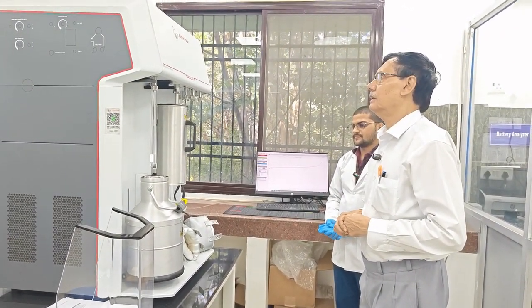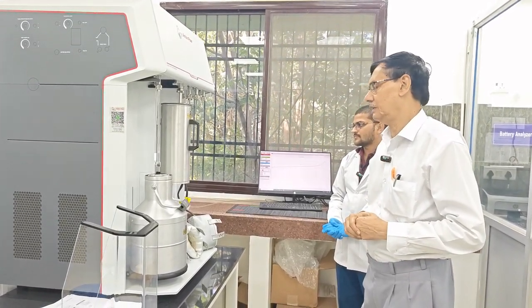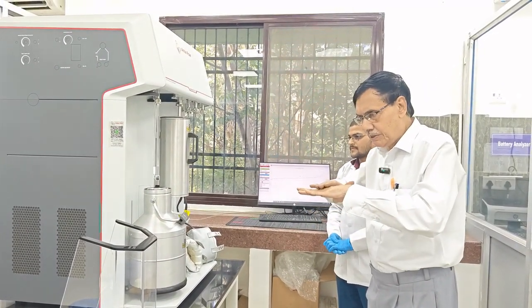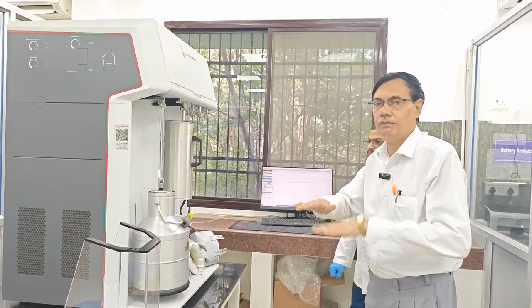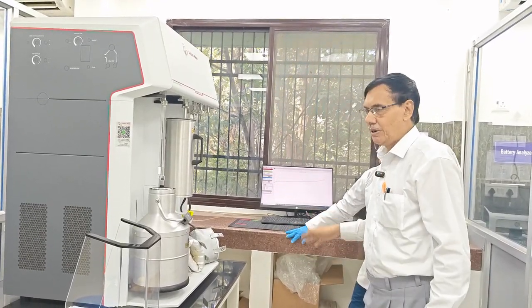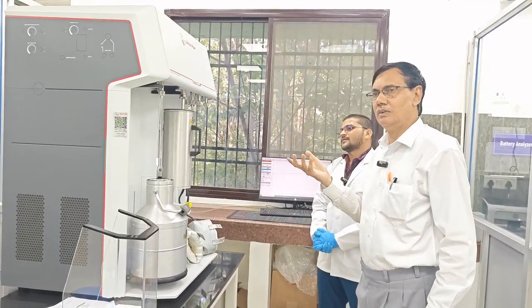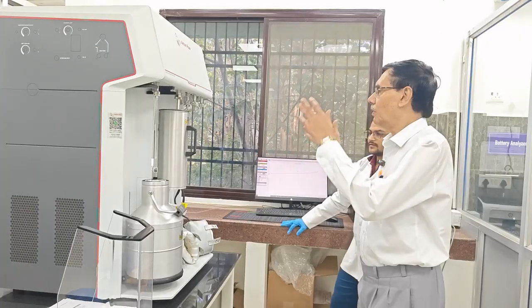Also in literature, a large number of models are available. But it is a great opportunity for the MSc students, undergraduate students and research scholars to understand the system. The basic principle is exactly the same, like the Langmuir adsorption isotherm. One is adsorbate, another is the adsorbent. So here they have prepared some boron doped carbon fibers. You can also use silica nanoparticles. And what is the importance of this study?